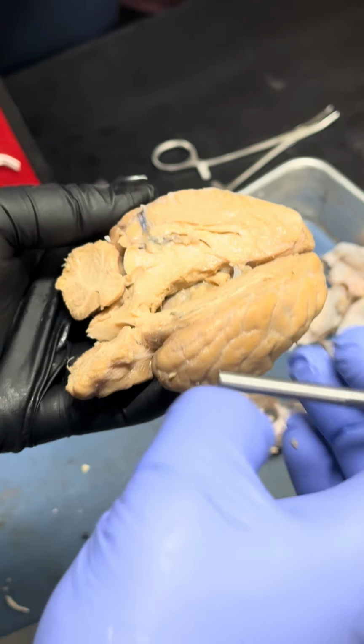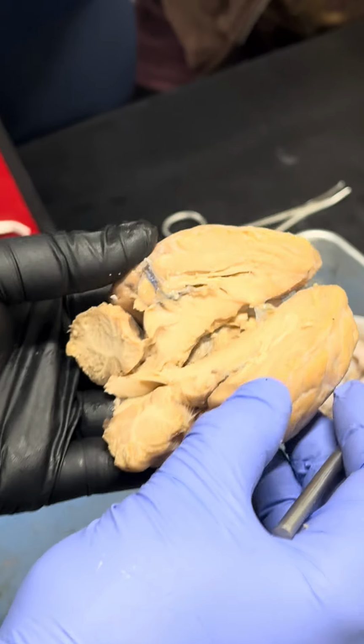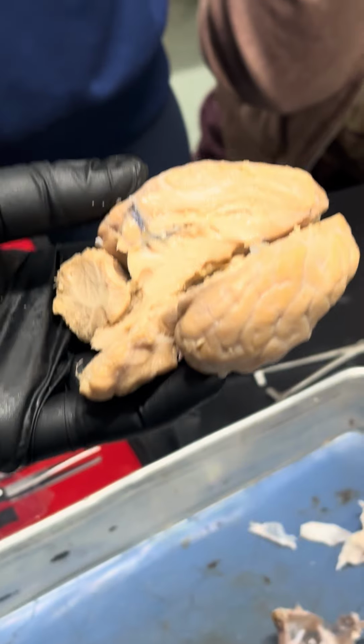Okay, so these are the structures they're going to ask you during the exam. So you have to memorize all these structures. You dissect now. You have a specimen given. You dissect, and if you have any question, you can talk to me.